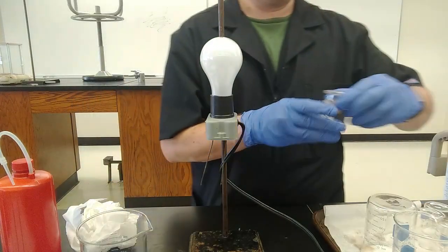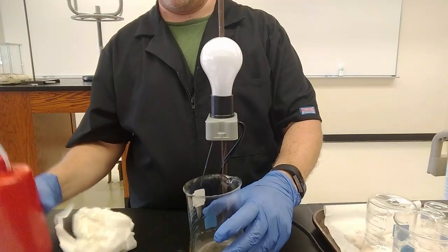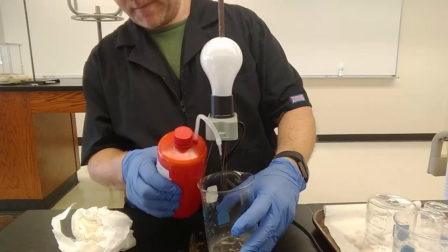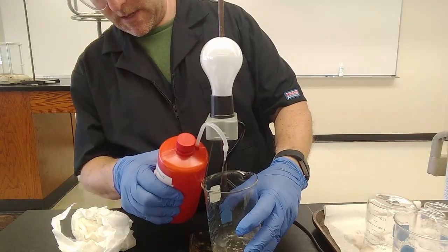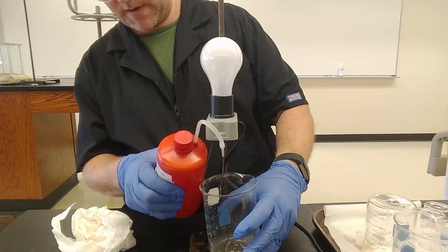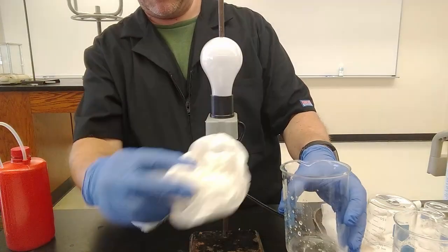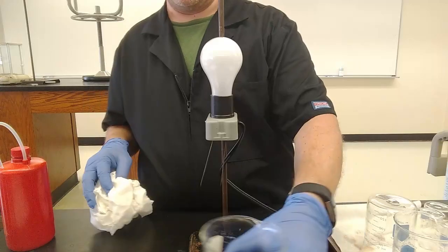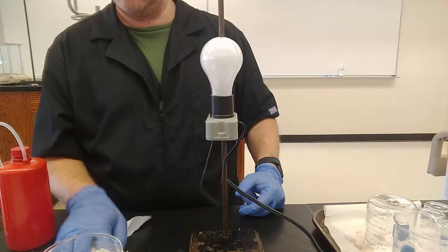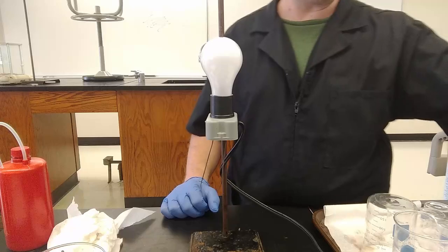All right. Let's clean off our electrodes for the next one. Just put a little waste beaker underneath here. Should unplug this for safety, but we're not going to bother. And make sure we get the other electrode. As long as I don't cross the two streams, I think we're probably safe here. All right, nice and clean. Could dry it off if I want to. Okay, waste beaker. Next up, sodium bicarbonate, aka baking soda, but as the solid.